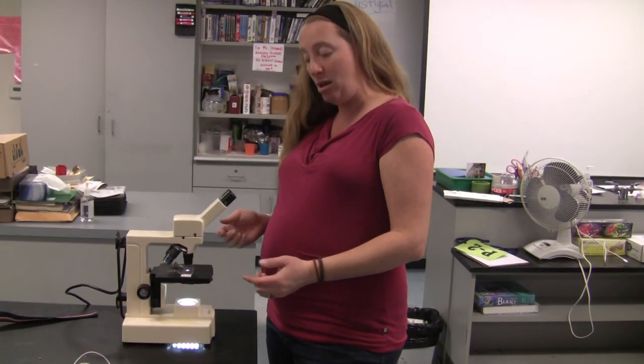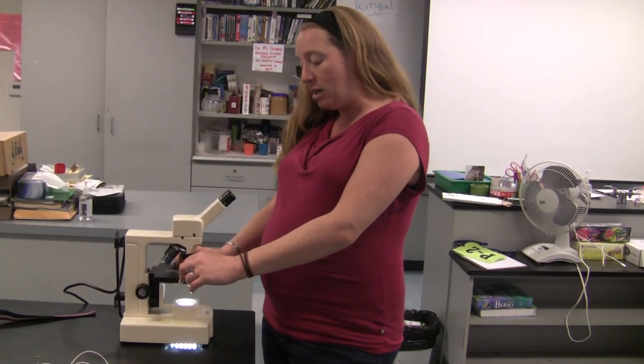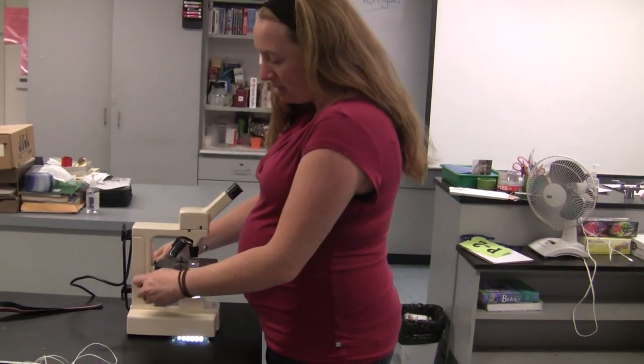If you can't find anything, chances are it's looking through a part of the slide that doesn't have your specimen on it. So move the slide around. Chances are you'll find it. But once you move it around, you got to bring the stage back to the bottom.